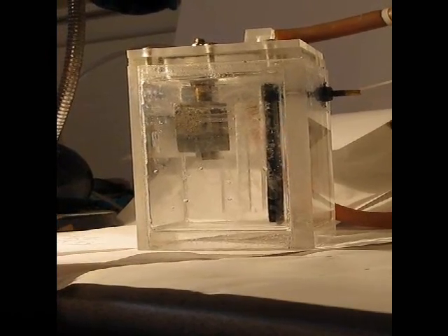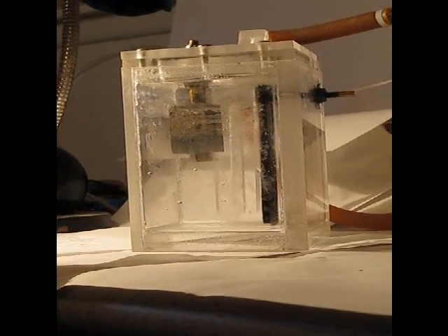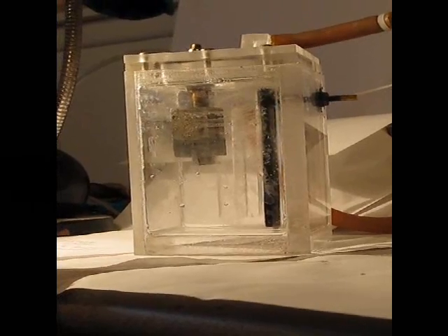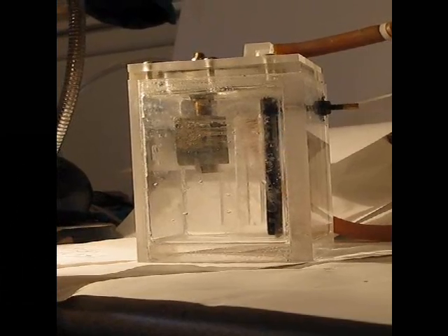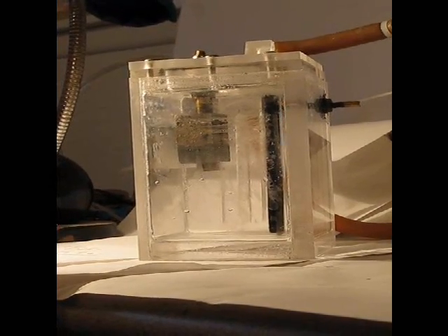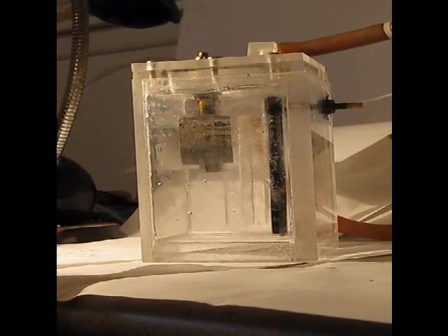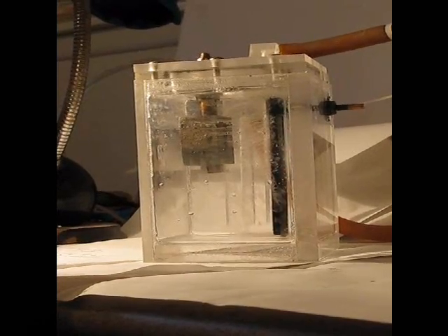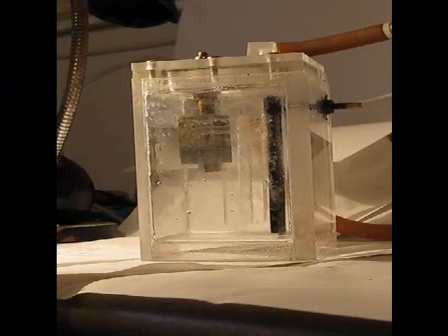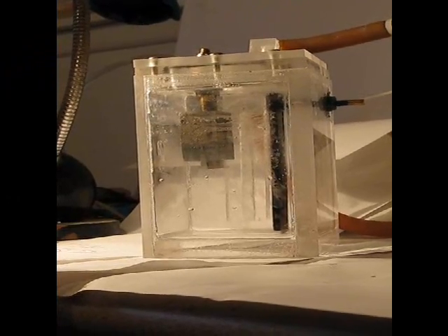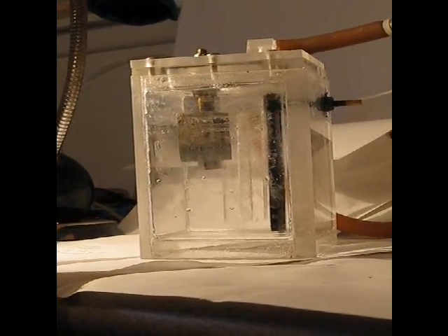This is a base reaction. I'm using colloidal silver and colloidal magnesium as a catalyst for the reaction along with a few other elements that I won't disclose at this time, and it's comprised of 30% by weight sodium and potassium hydroxide, so it's a fairly strong base.